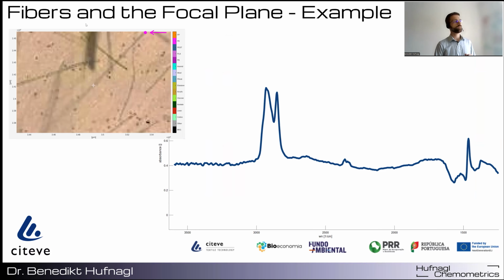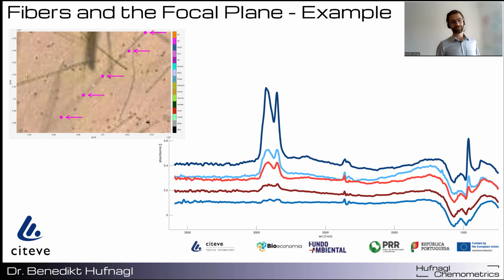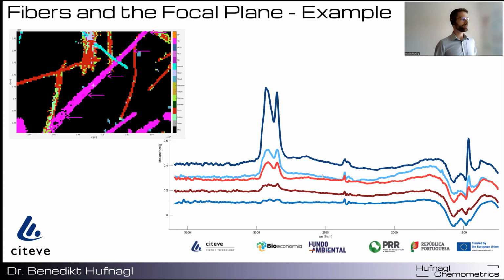So this is a nice polyethylene spectrum. Also, the next spectrum, I would say, is still okay. You can recognize it well. But the further we go, the signal decreases more and more. The peaks get weaker and weaker, up until this point where there's almost no signal left. And now the question is, can we still detect that with machine learning? Yes, in this case, it is still possible. Machine learning models have very powerful capabilities concerning these effects and also dealing with very low signal-to-noise ratios.